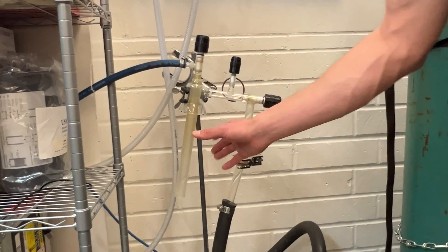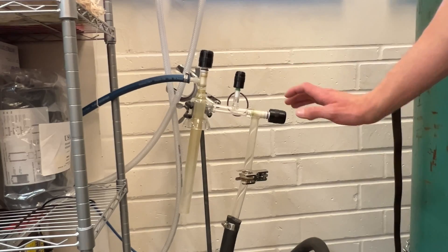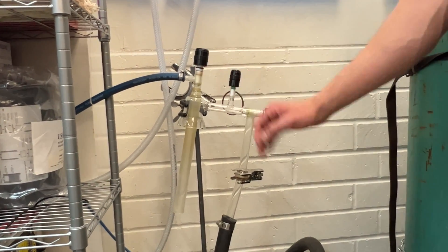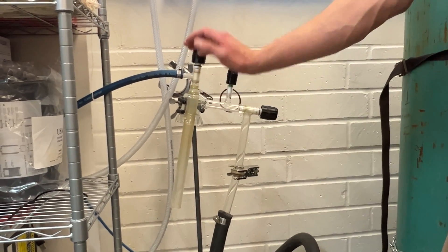We do have a bulb here that I'll show you later that has its own individual ring and clamp. We do have our valve switches, which we need to make sure we understand which ones go where. For example, this is to localize the vacuum until this point. This is our evacuation valve and this is our valve switch that goes into the glove box.